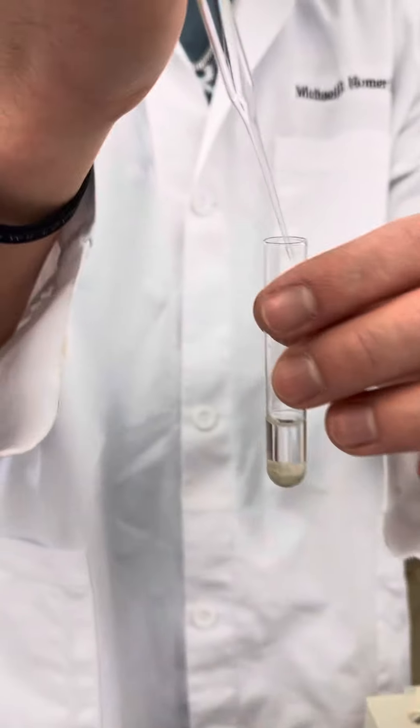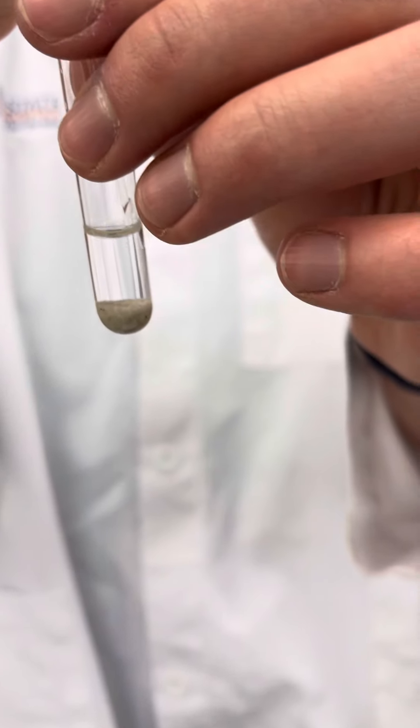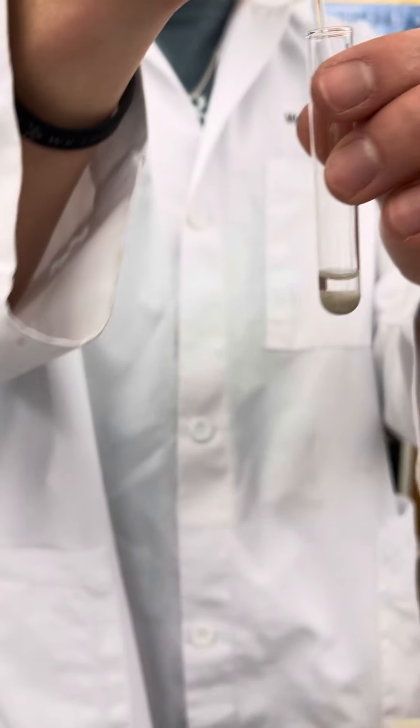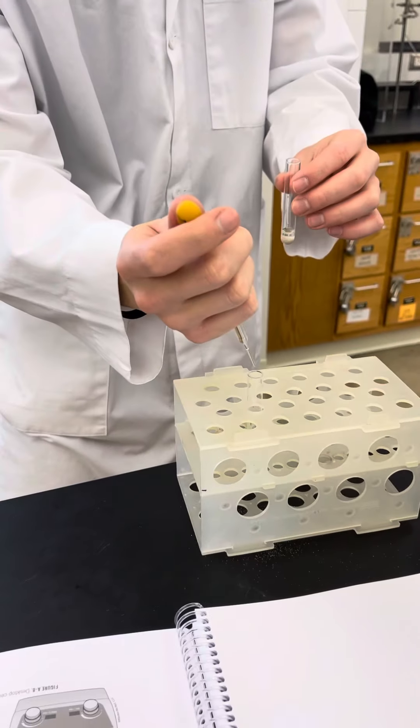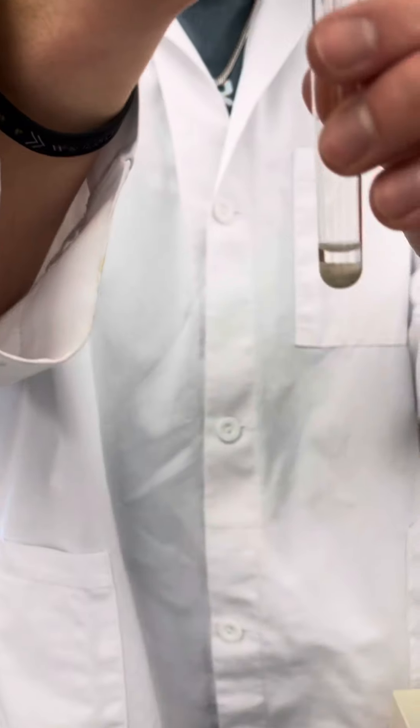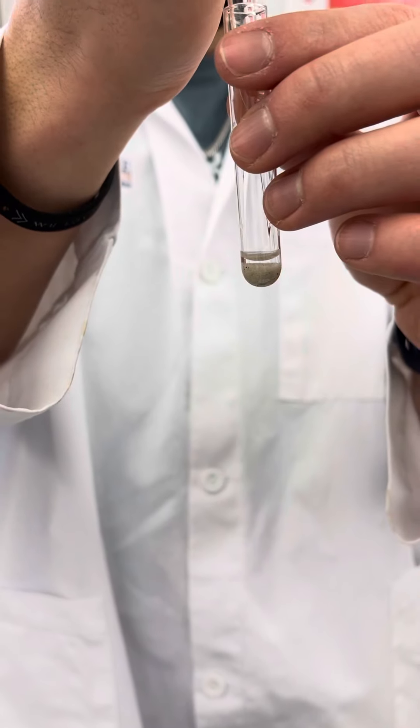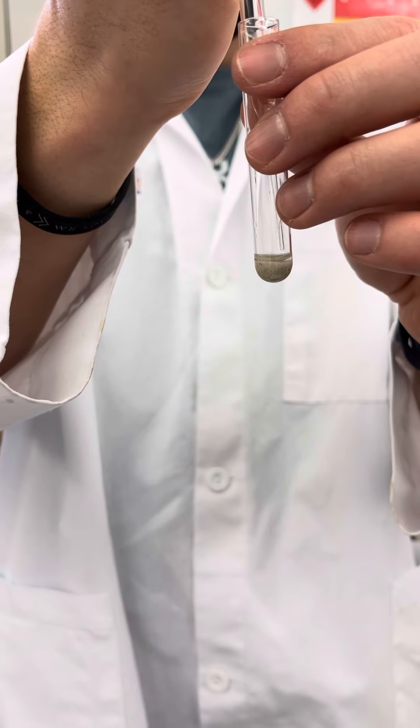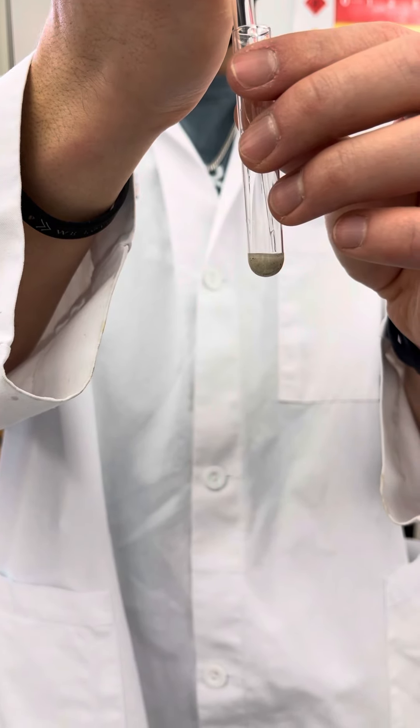You're going to try to only take out the liquid without disturbing your precipitate. You want to take out as much as you can, so that you only remain with precipitate and as little liquid as possible.